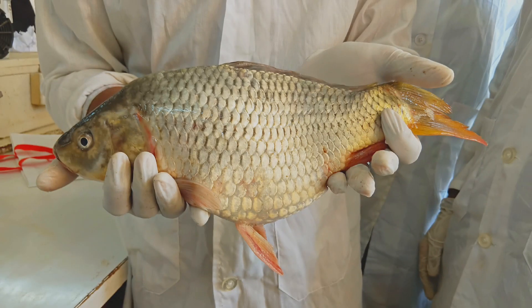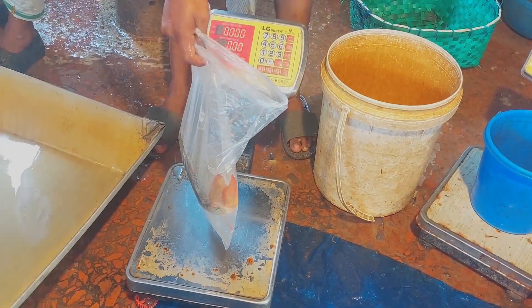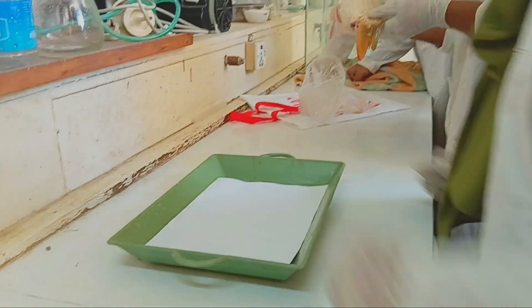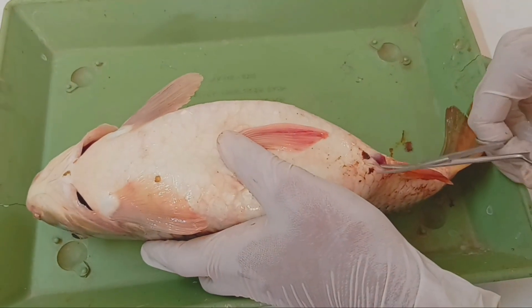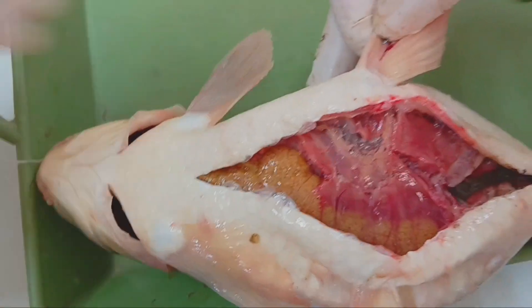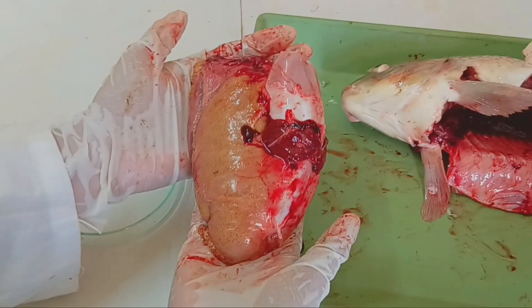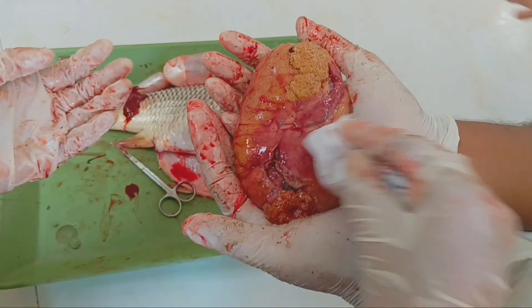In this lab work, we worked with a mature female common carp collected from the local fish market to estimate fish fecundity. The fish was first placed on a clean tray for dissection. Using scissors, we made a careful incision starting from the anal opening along the abdominal region to expose the internal organs. The paired ovaries filled with developing eggs were gently removed from the fish body. We then cleaned the gonads using tissue paper, removing all traces of blood, fat, and surrounding tissue.